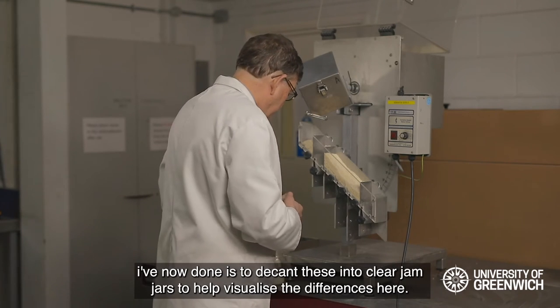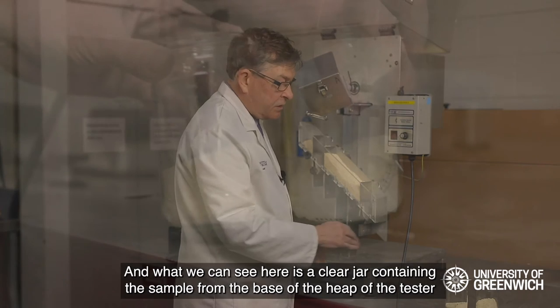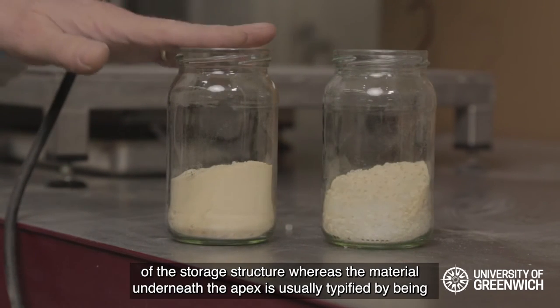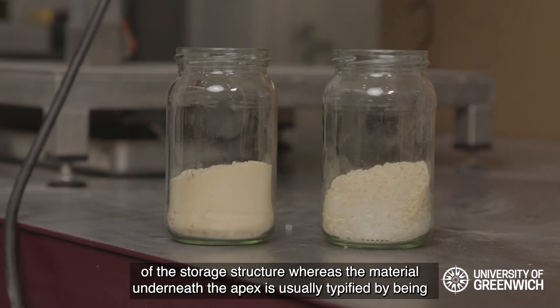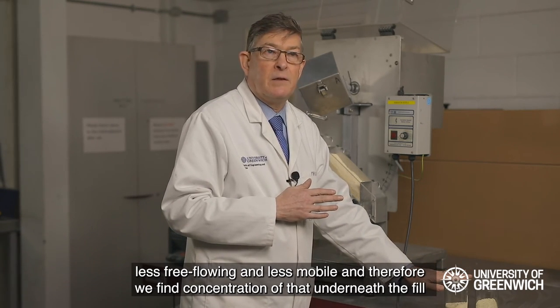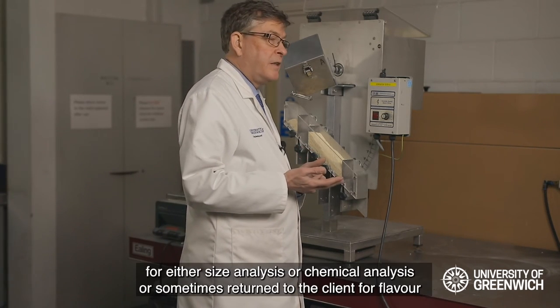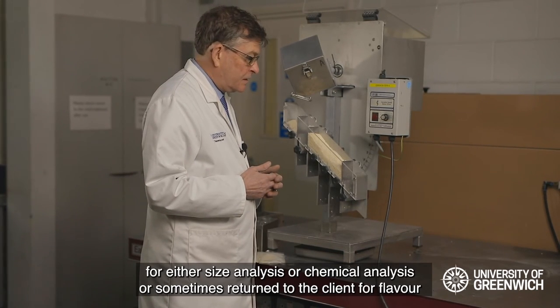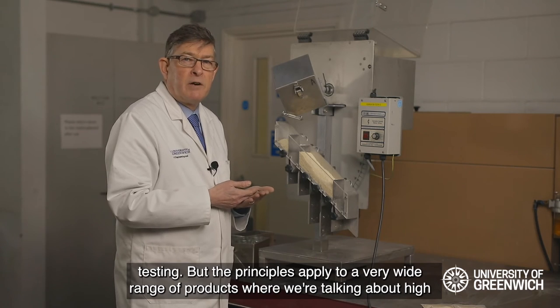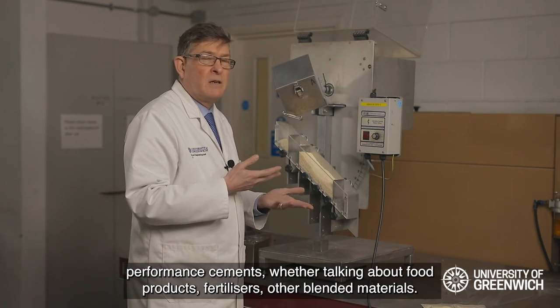Having extracted the samples from the test rig, I've decanted these into clear jam jars to help visualize the differences. What we can see is a clear jar containing the sample from the base of the heap, whereas the material from underneath the apex is typically less free-flowing and less mobile, and therefore we find a concentration of that underneath the fill point. Normally these samples could be used for size analysis, chemical analysis, or sometimes returned to the client for flavour testing. The principles apply to a very wide range of products — high performance cements, food products, fertilizers, and other blended materials.